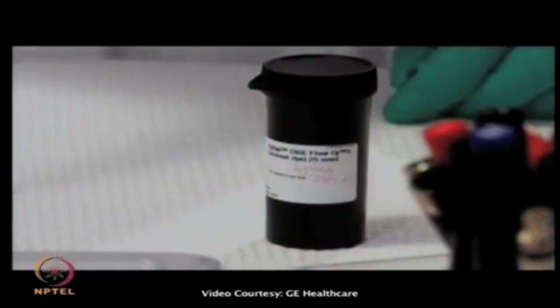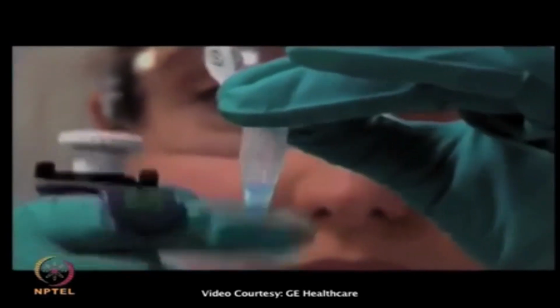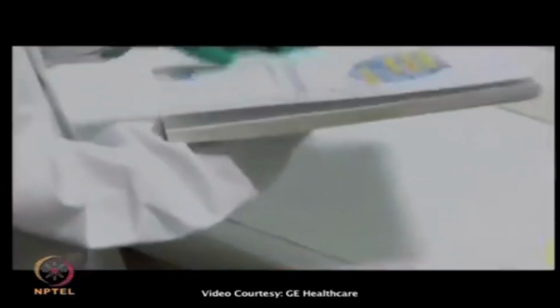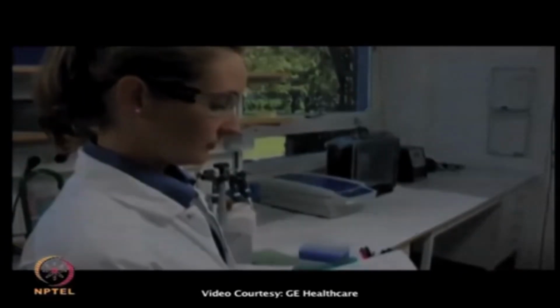The optimal ratio of CyDye to cell number will vary depending on the cell type, since we do not know the exact protein concentrations on the cell surface. How to determine the optimal conditions for CyDye labeling of proteins is described in the 2D electrophoresis Principles and Methods Handbook.